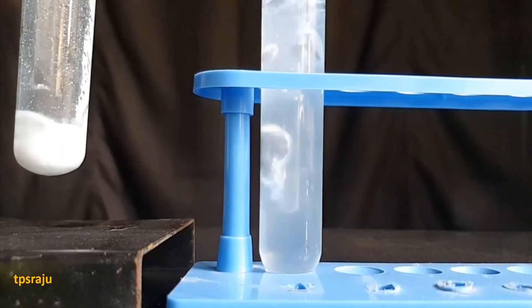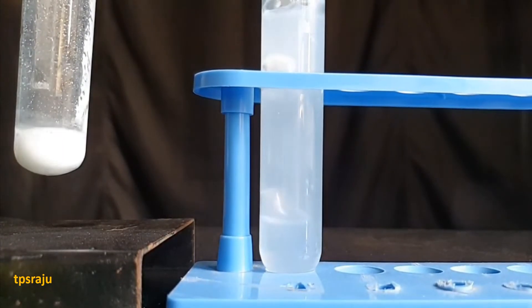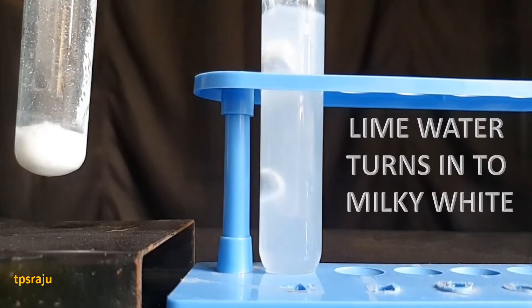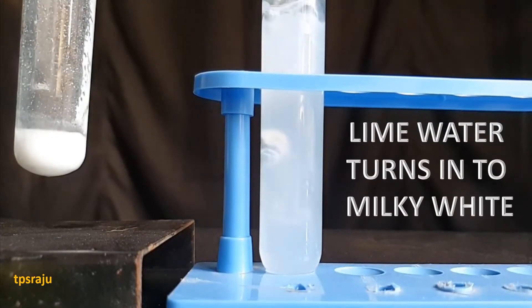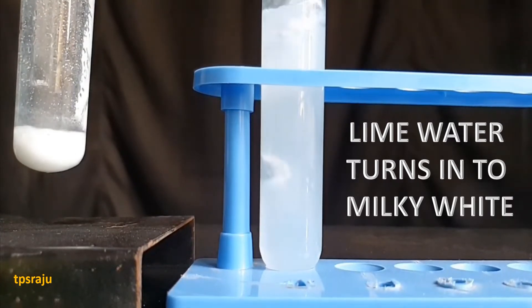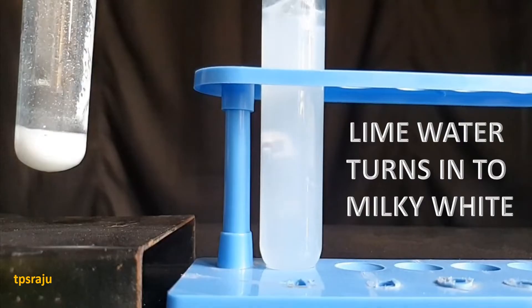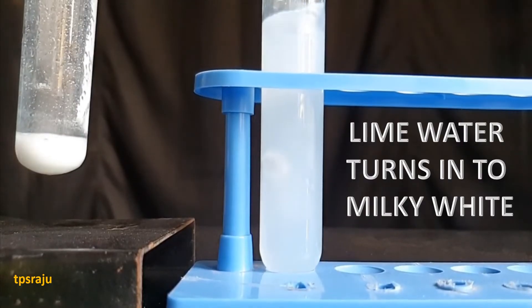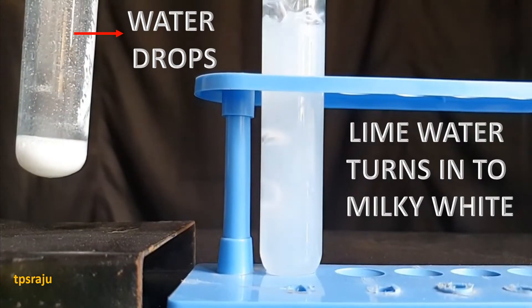The gas which is formed in the test tube passes through the lime water. Due to this, the lime water turns milky white, which indicates that the evolved gas is carbon dioxide. Observe carefully — water drops are also formed in the test tube.